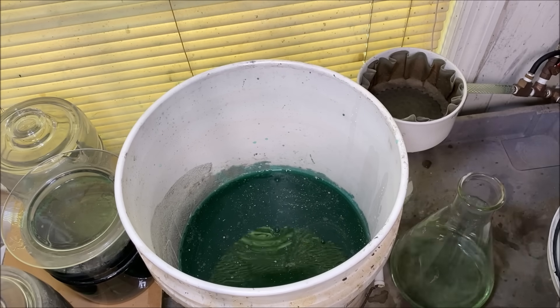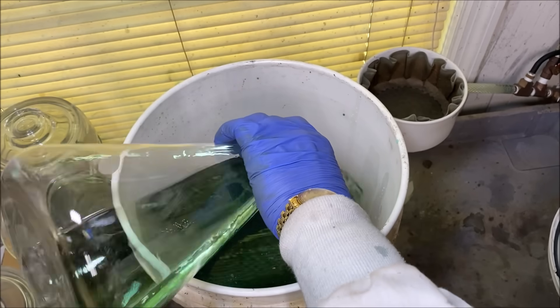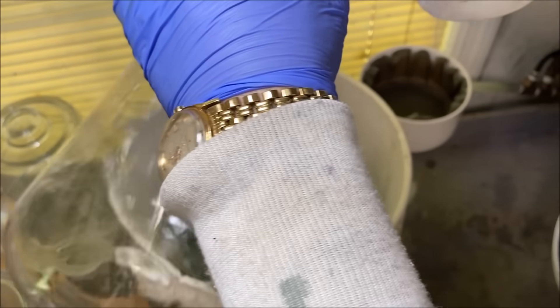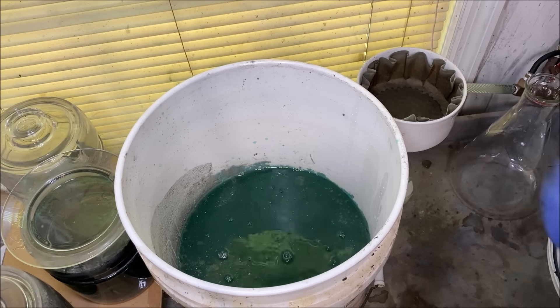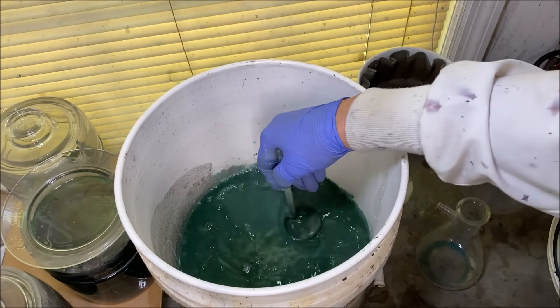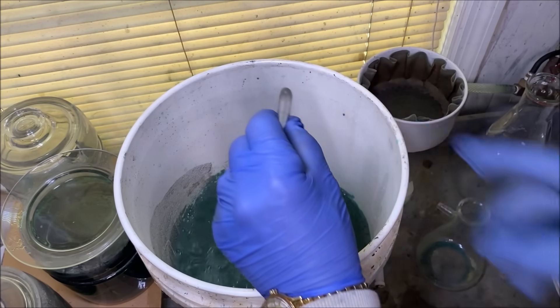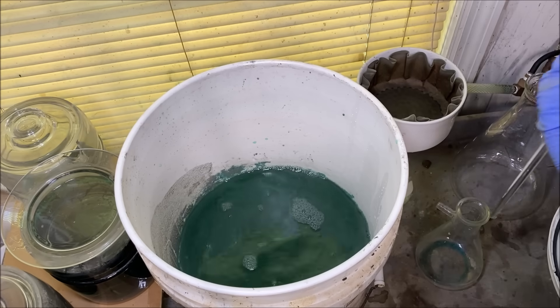This is some rinsed water that I had in a separate flask — let's add this into this bucket as well. Now what we'll do is just let this liquid react with this piece of copper in here. I'll stir it up, cover it up, and take it out under a rain cover because it's probably going to give off some fumes.